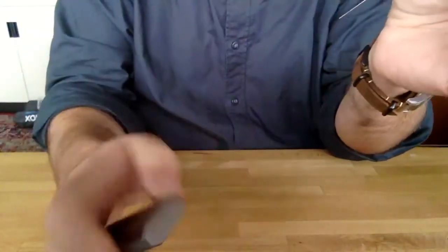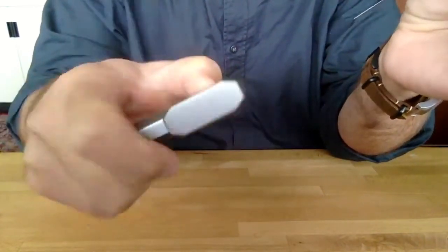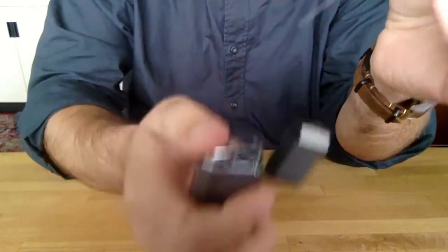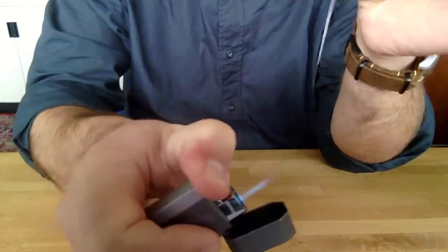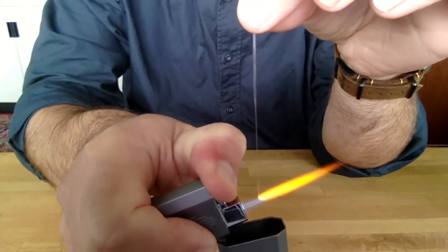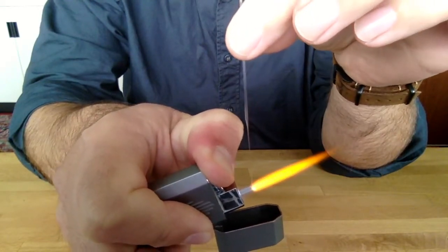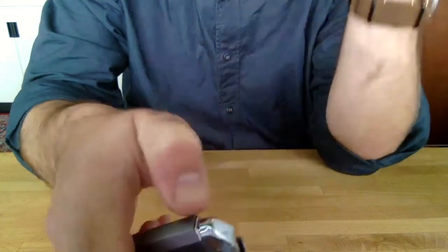And then you take your hotter flame, start with this, the Ronson, see how it works. You get the jet of flame going, and then I'm going to lower this into the jet, and you're going to see this big orange comet tail. And that's the glass melting. There it goes. And it will melt into a sphere. You just feed in as much as you like, and then you're done.